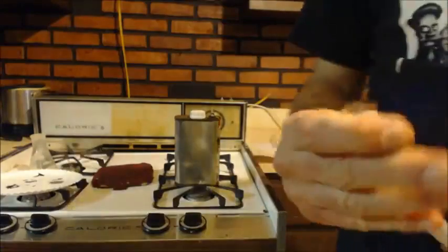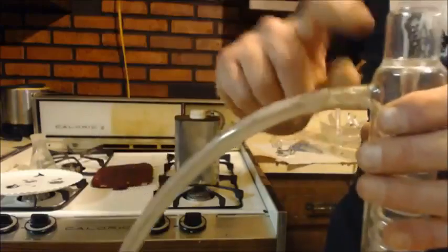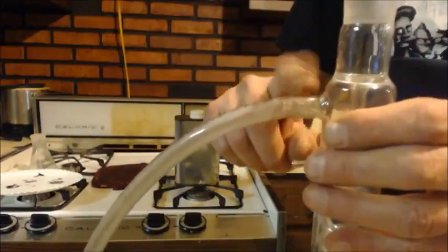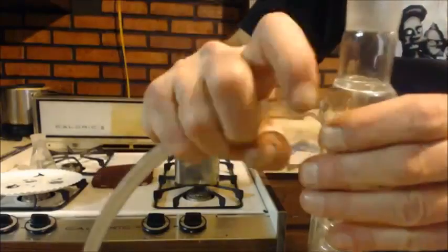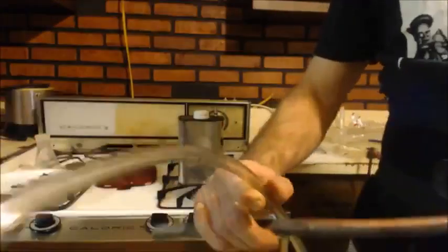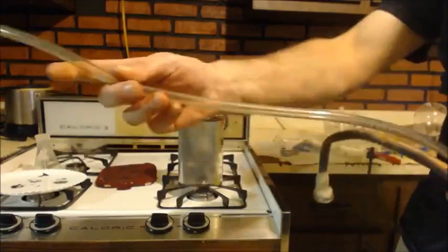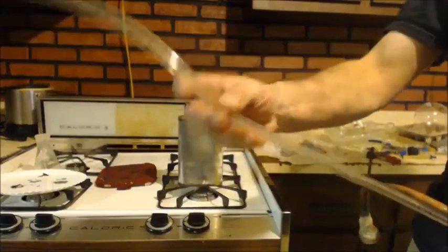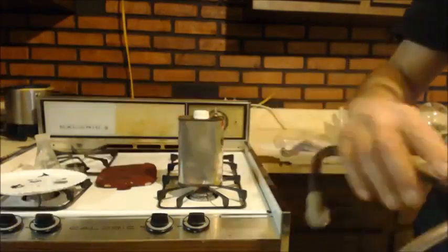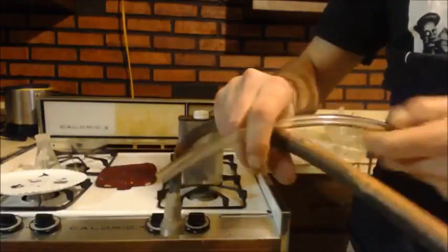So all I'm using to connect my pump up to this is this hose here, right? Just like on this condenser, my pump has a barbed thing like that, and I just shove the tube right in there. That's all it is. Take the tubing, you can stretch it out to your pump. So this is my extra tubing that goes to my pump, right? Then I come back to this part. I don't have enough, so I'm going to move it over.